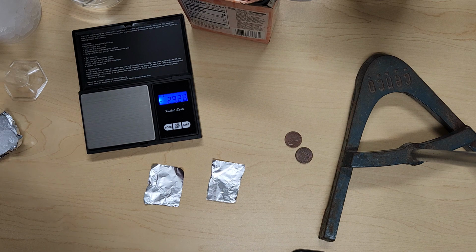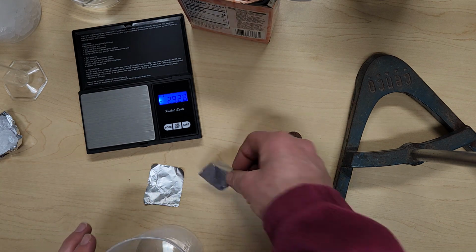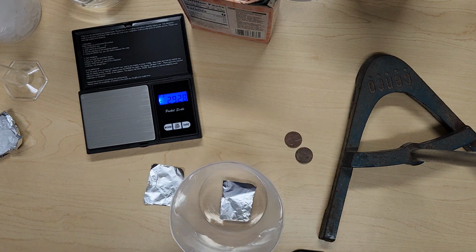Okay, so the very first part, we're going to put our aluminum foil into a clean, dry beaker. Add some water. Okay, wait for 2 to 5 minutes and make some observations. Rinse it, dry it, see if anything has changed by adding that aluminum foil to the water.